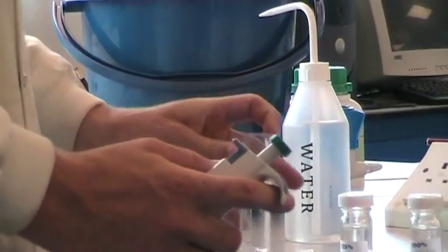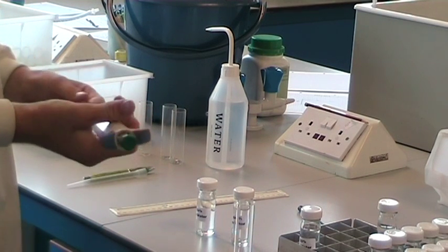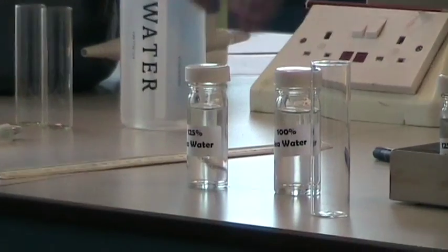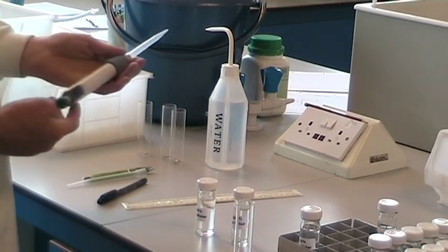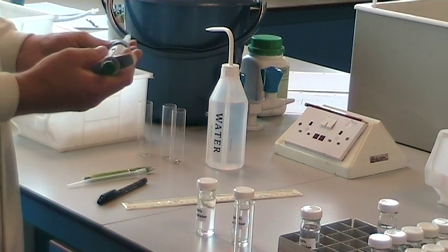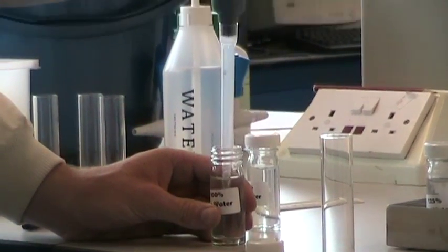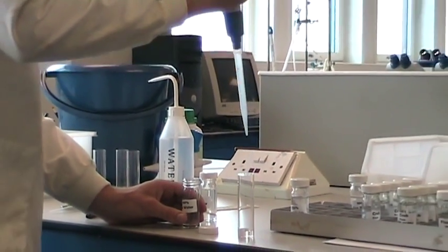To make these standard dilutions, you want to make them in a 10 cm cubed volume. To make 80% sea water, you would use 8 ml of 100% sea water and 2 ml of distilled water. To avoid contamination, mark one of the pipette tips to ensure you don't use the 100% salt water tip with distilled water. To make 80%, press it down to the first stop and allow it to suck up, then push it down all the way to release and eject the water.